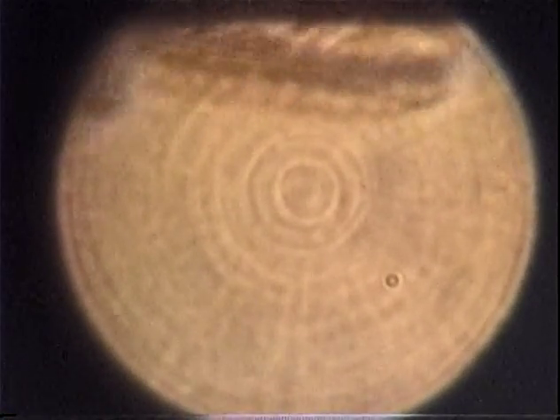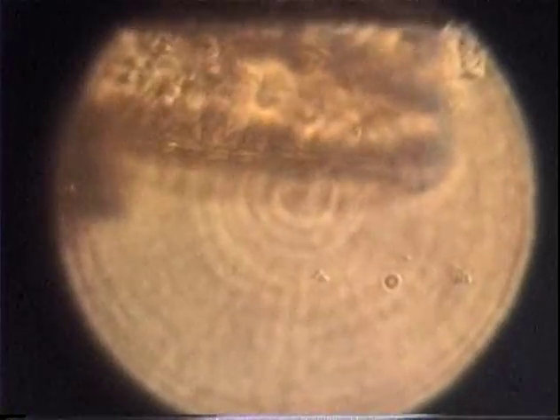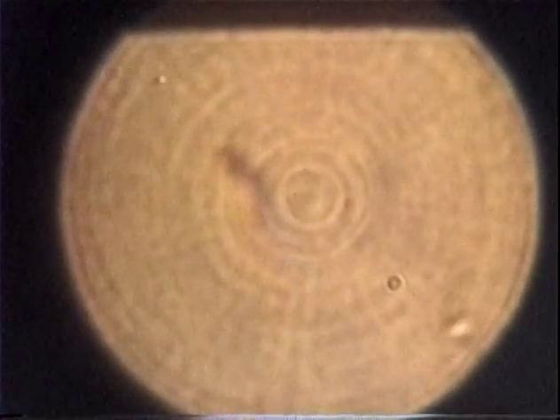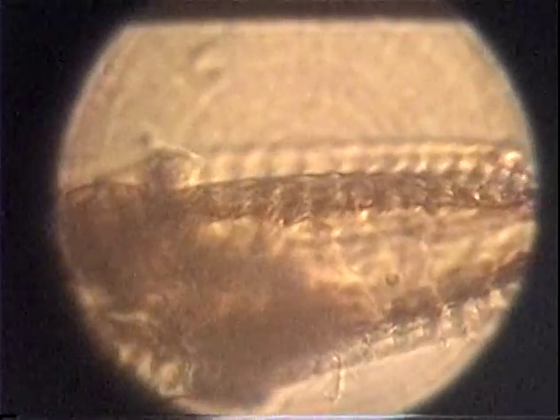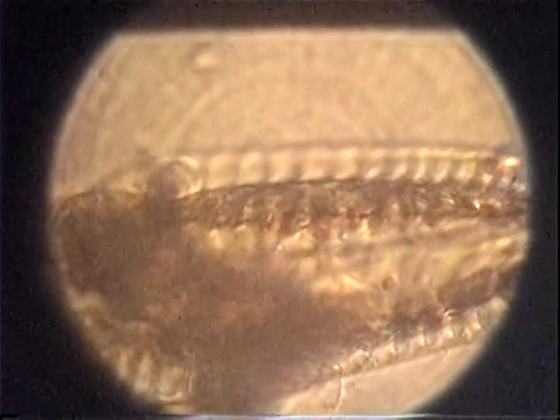What's that, an amoeba? It's a giant. Oh, cool. Look at it. It even has living things right there. It's alive. All right, guys, I want y'all to work on this drawing. It looks like a rocket ship with a flat top. That other one we saw that was dead looks like a rocket ship.